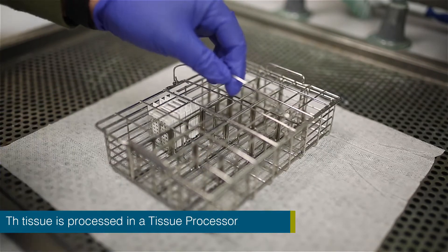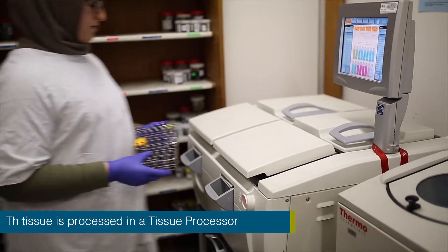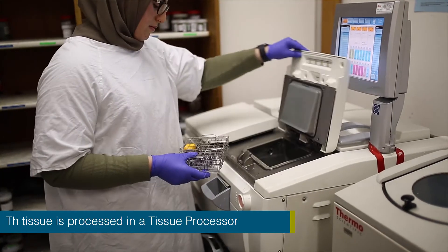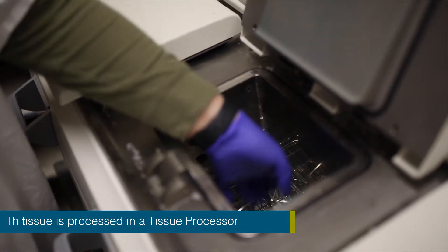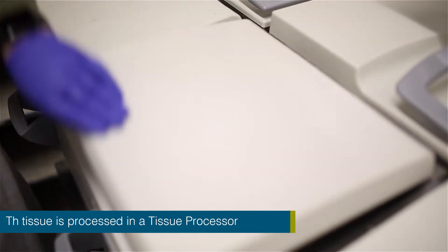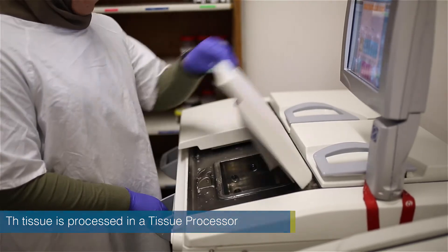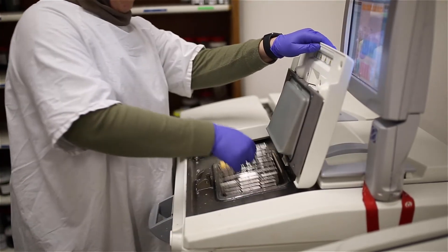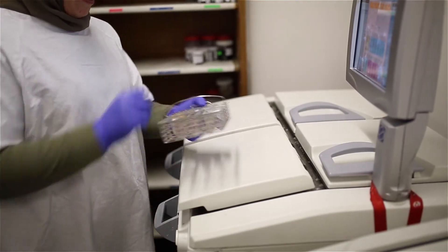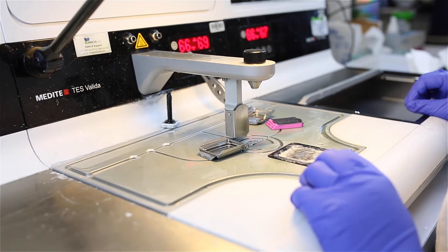This step involves several stages of hydration and dehydration using several types of chemicals. The processing time will vary depending upon the types of specimens. Smaller pieces of tissue will require less time whilst larger pieces of tissue will require a longer cycle.